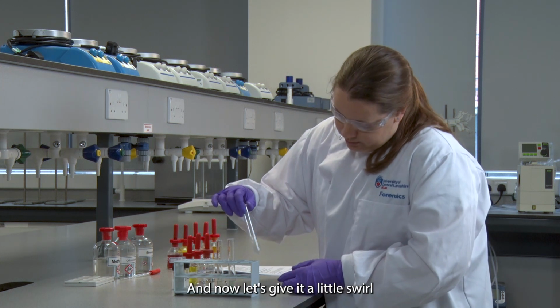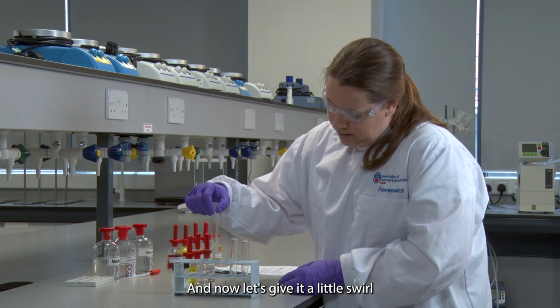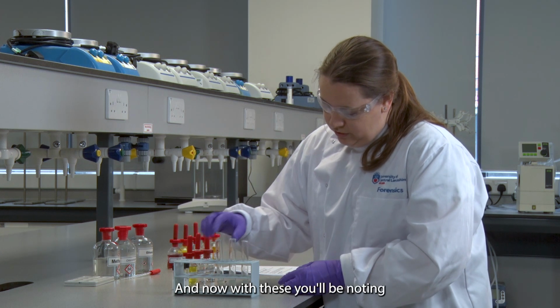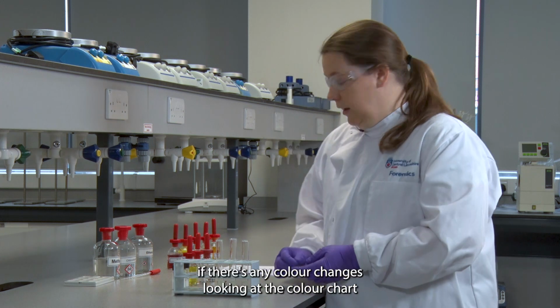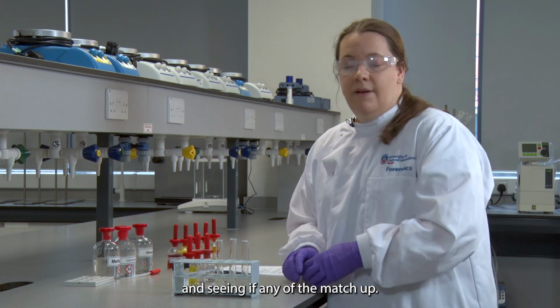And now let's give it a little swirl. And now with these, you'll be noting if there's any colour changes, looking at the colour chart and seeing if any of them match up.